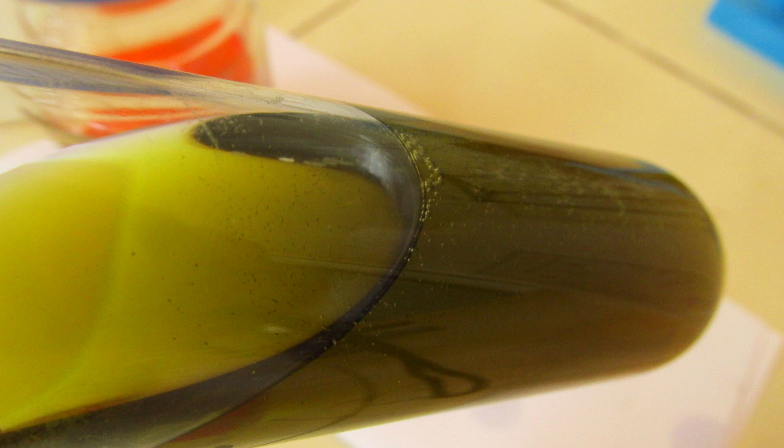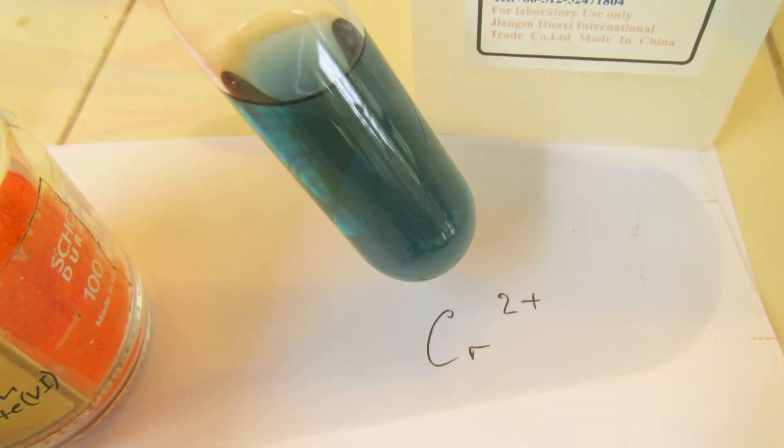actually if you heat the mixture, you get blue color. If I heat it, and if there's enough of my ethanol reducing agent there, the color changes even into blue.